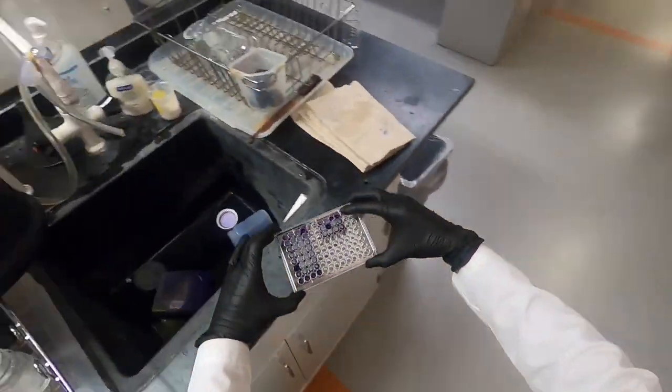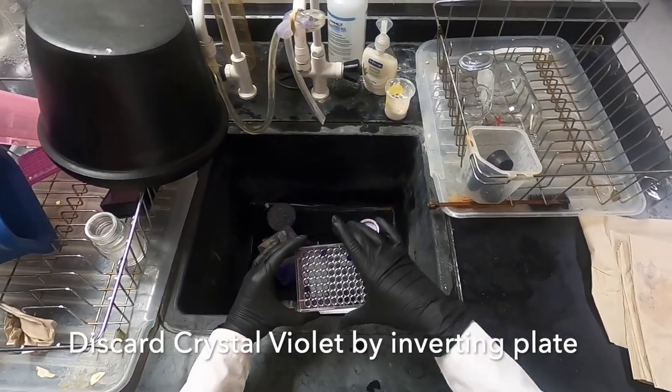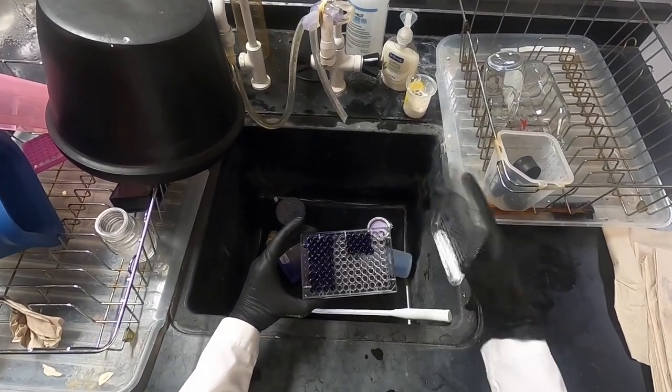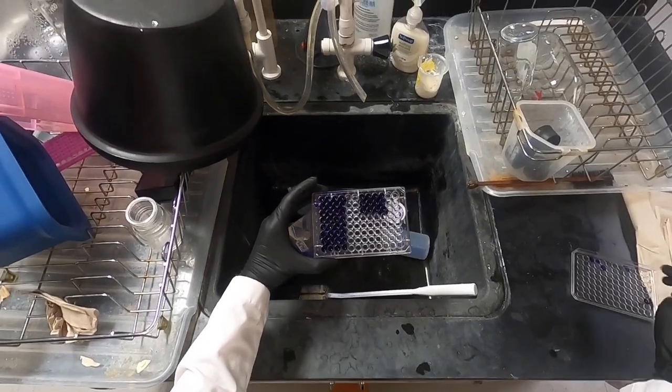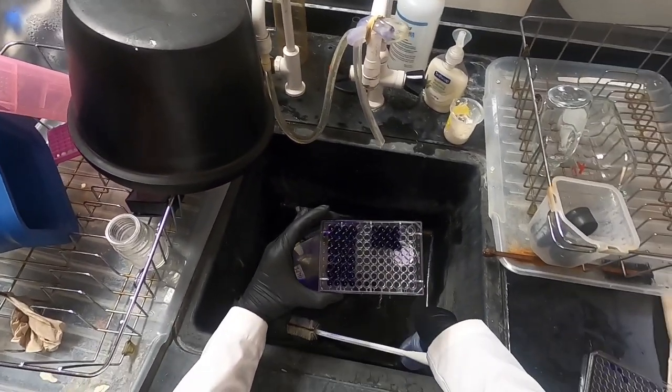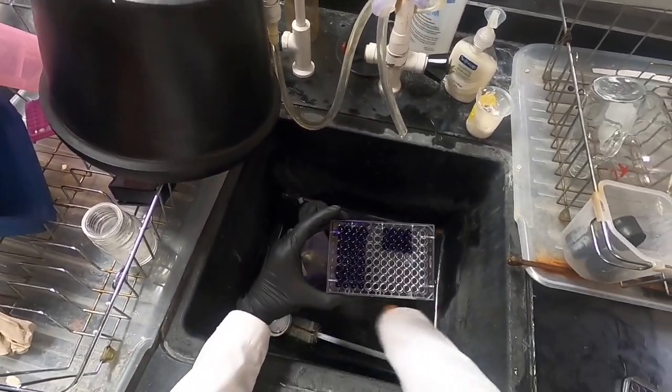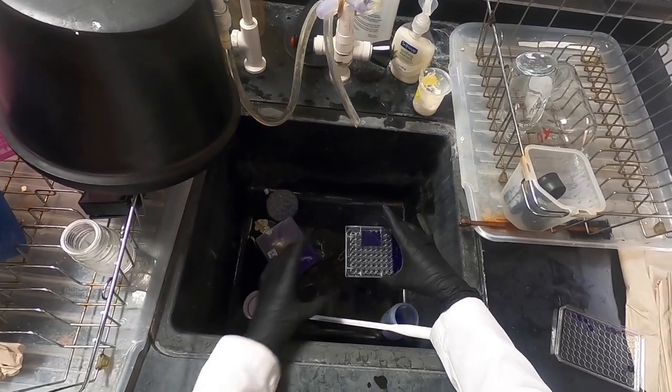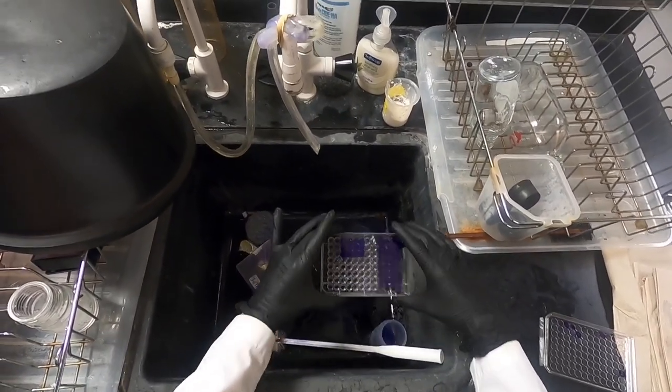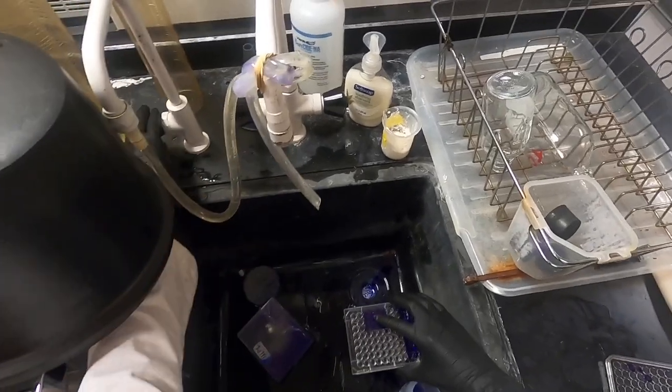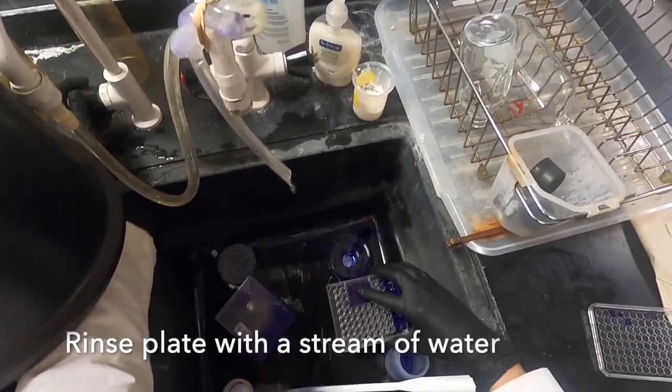Now that the incubation period is over, we will discard the dye by inverting the plate. A slight tap will remove any excess dye that remains in the wells.